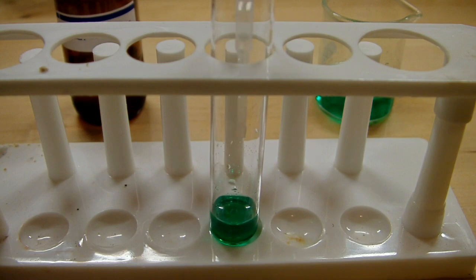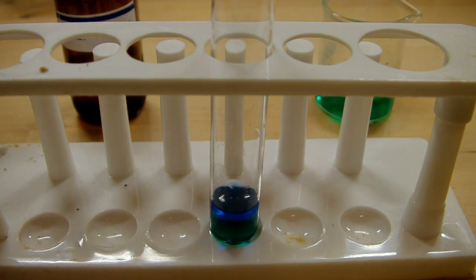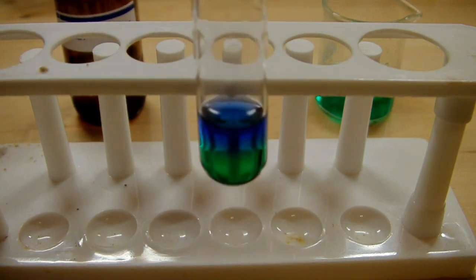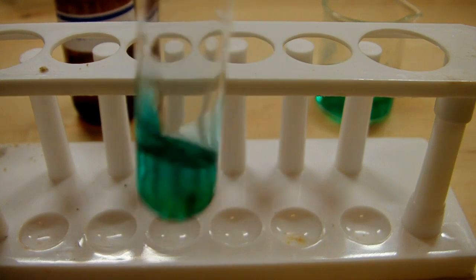So we'll add the ammonia. Just one milliliter of it. You can see we get a really cool layering effect, and I'll just swirl that around to mix everything.